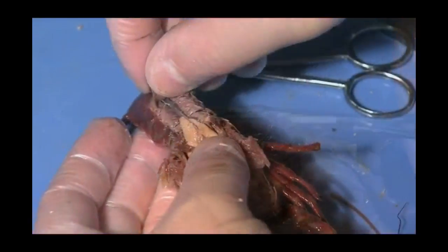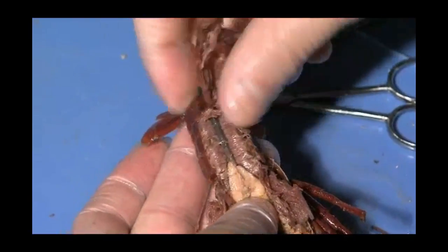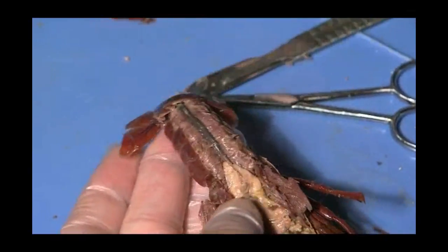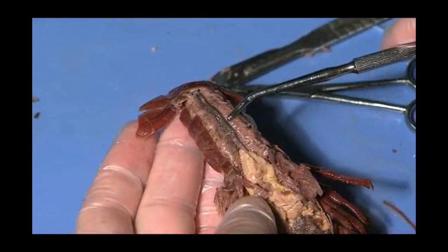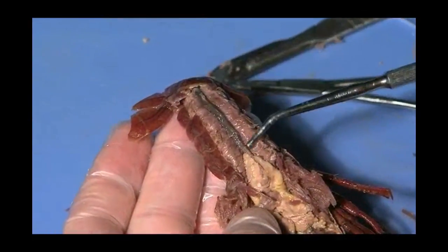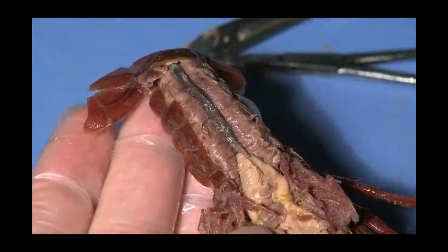Peel that muscle and tissue back, and that exposes the intestine, which is this line running right along through the middle of the muscle.